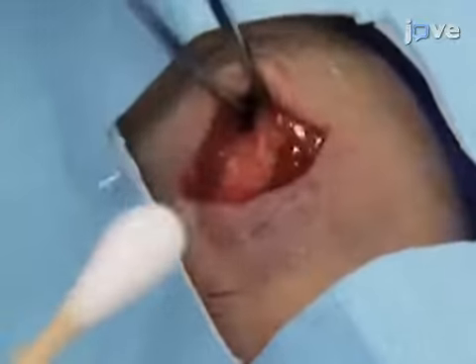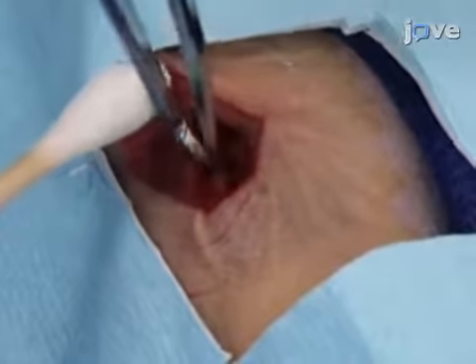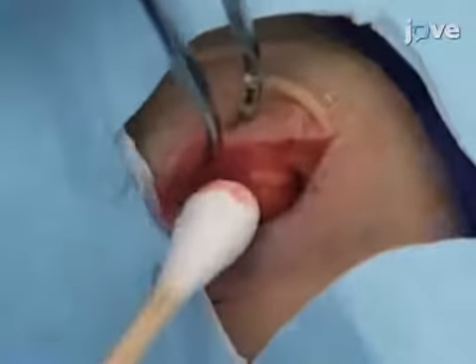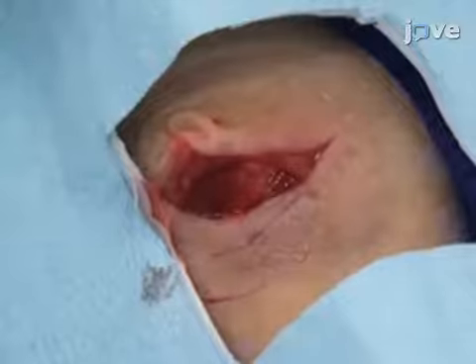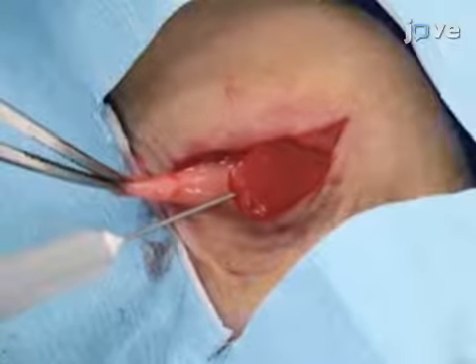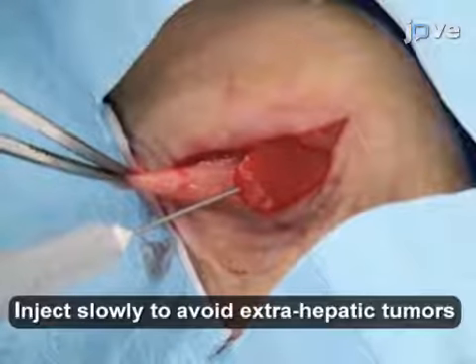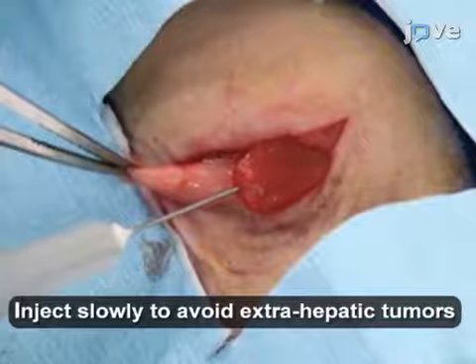Expose the spleen by using a cotton swab to gently apply pressure around the incision. If needed, the pancreatic fat can be gently manipulated to help with exposure so as not to injure the spleen. Using a 1 milliliter syringe with a 27 gauge needle, over a period of 30 to 60 seconds, inject 100 microliters of cells into the tip of the exposed spleen.